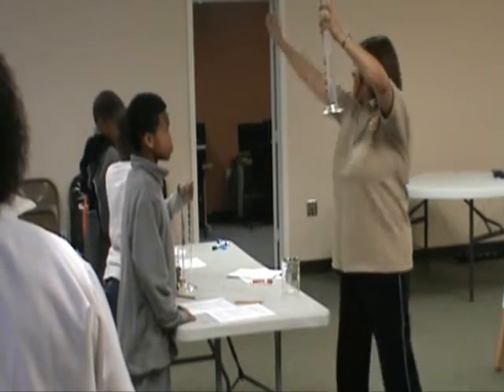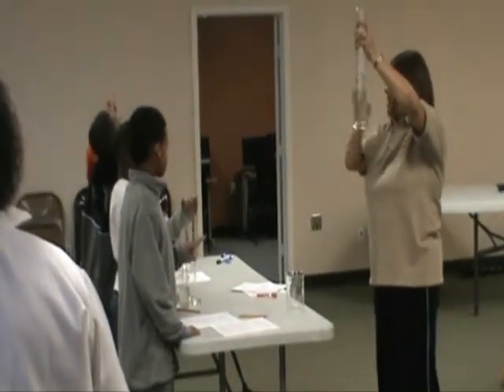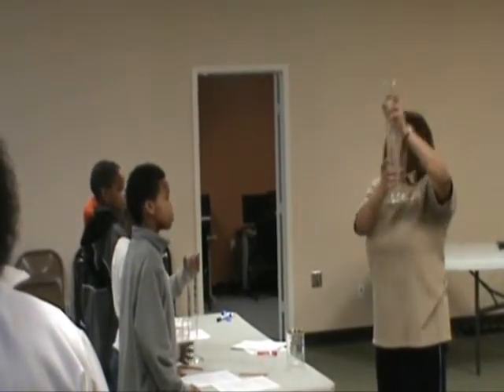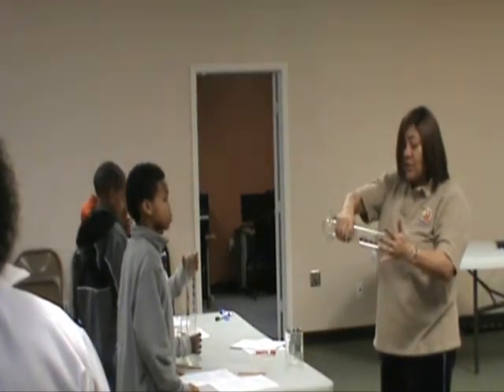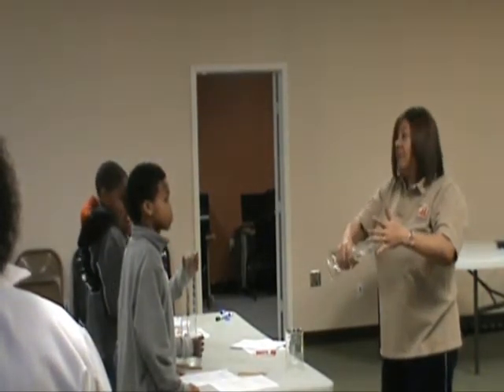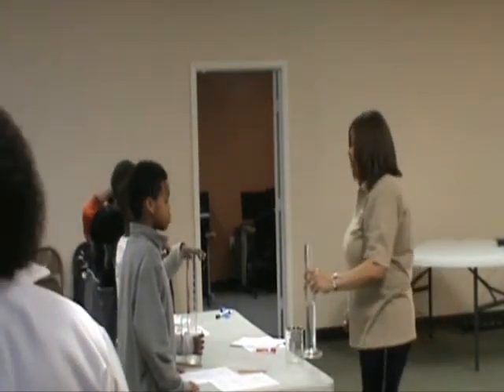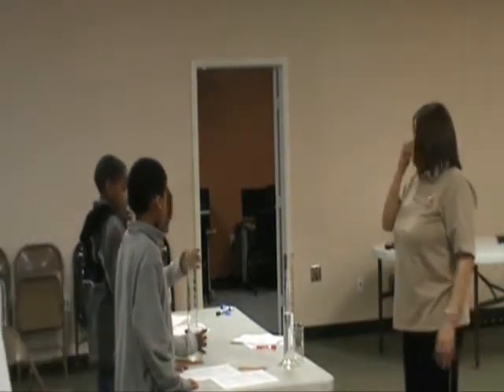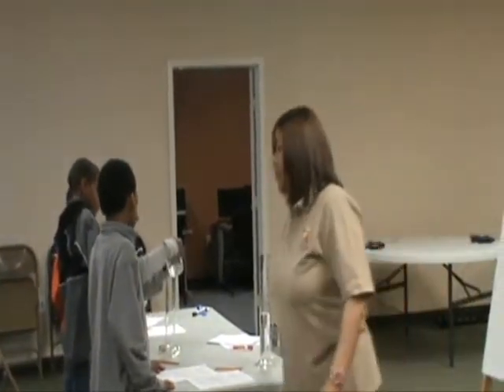So at this time, let's put our two hands up again and practice one more time because you're getting ready to do it. Why am I doing this? I'm removing what? Air bubbles. If they're stubborn, we'll just turn it over slowly, but you have to really be good at that one. I think you'll be fine. Now, from your beaker, slowly pour, tilt. You may tilt your cylinder. That'll be fine. You may tilt your beaker.